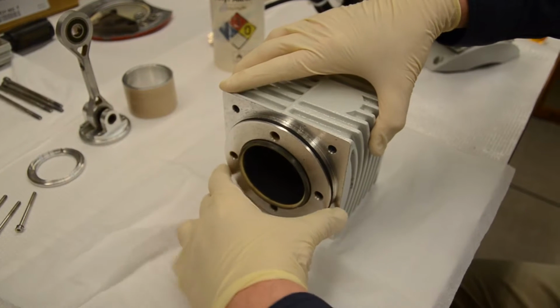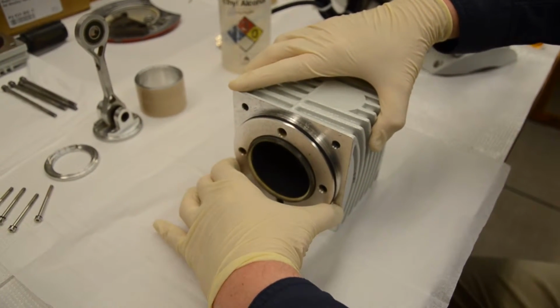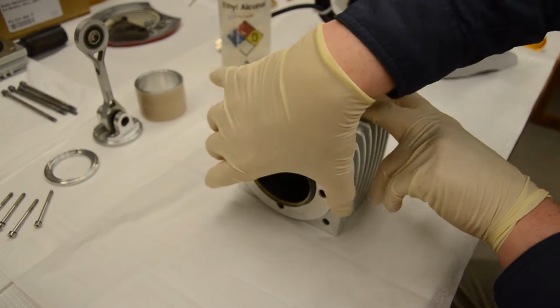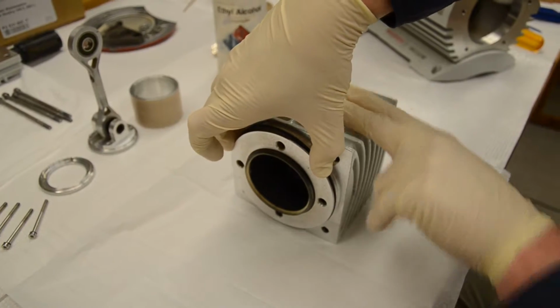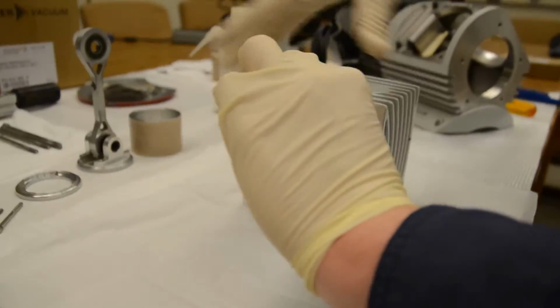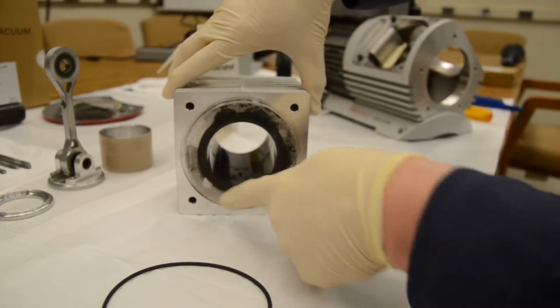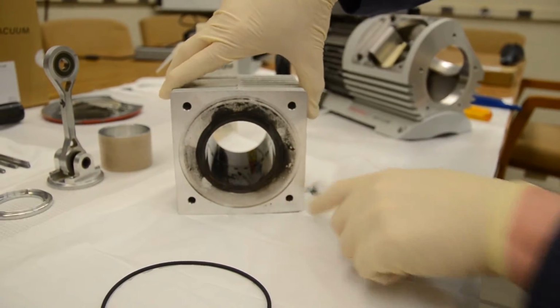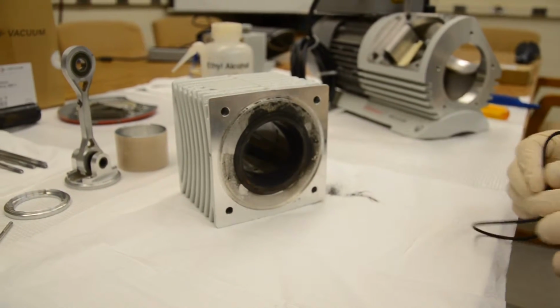In any case, what we're going to do is take off this O-ring. We're going to squeeze on the sides and lift up, and the O-ring will lift out of place. Comes right off. Now there was an O-ring here, but it easily was removed. Both O-rings will get replaced in the rebuild kit.